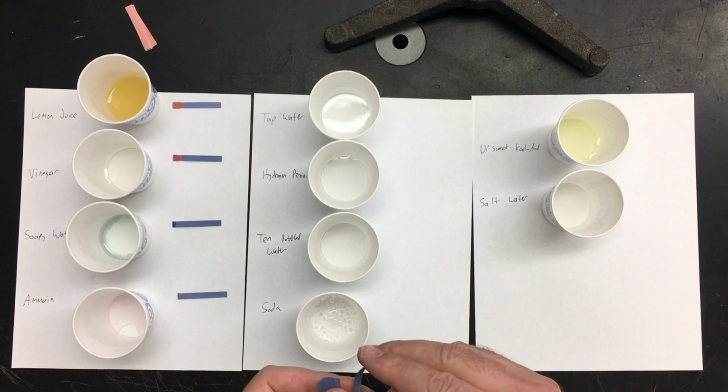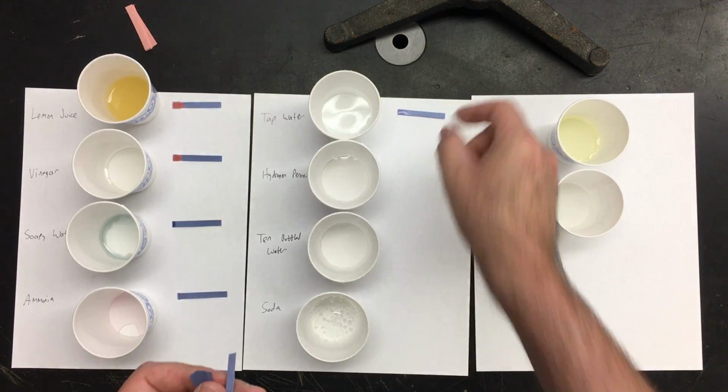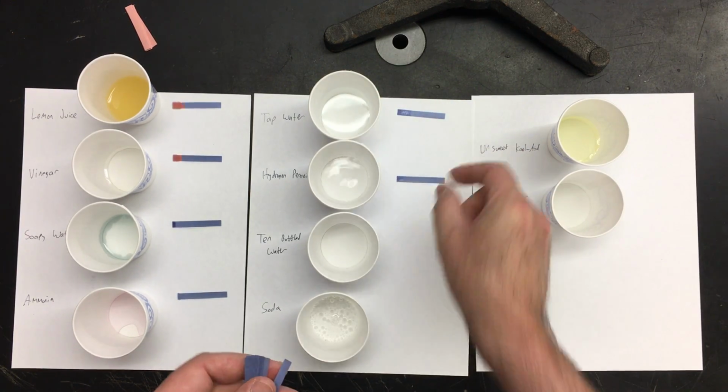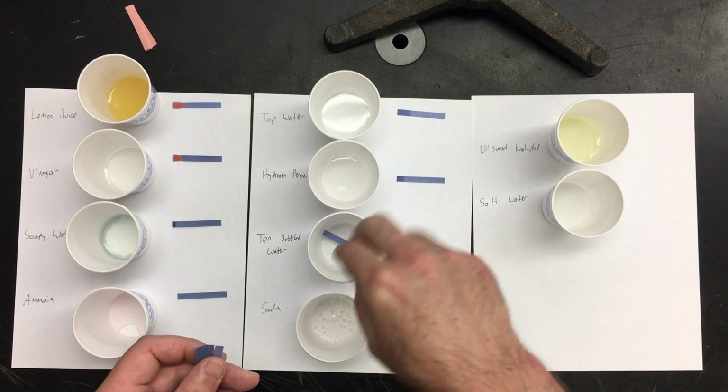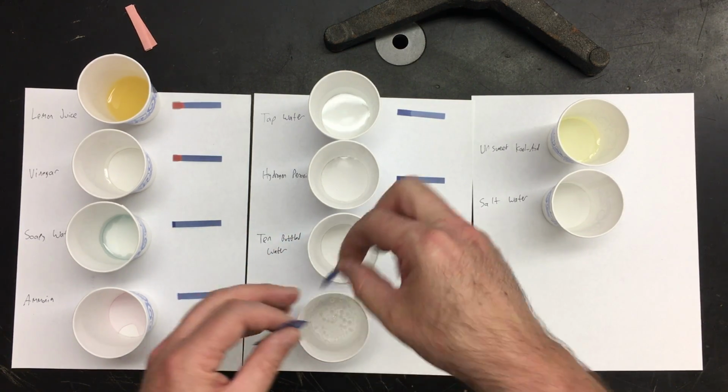Don't we smell that? It doesn't even smell good. Lemon juice? Yeah, it doesn't smell like actual lemon. Oops. Yeah, disgusting. Oh, there's a bag.